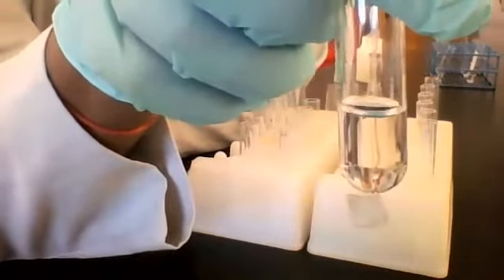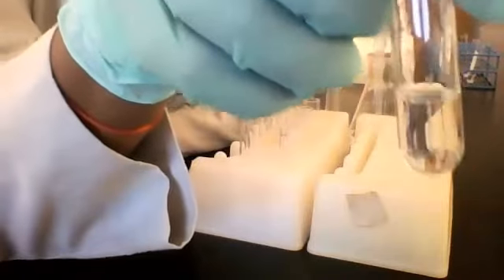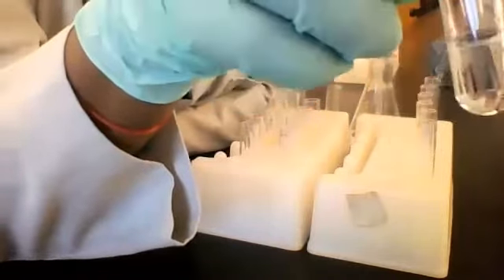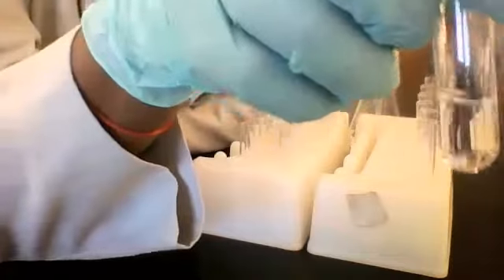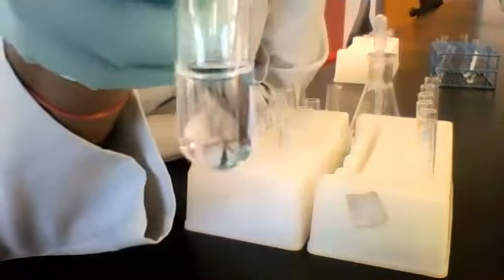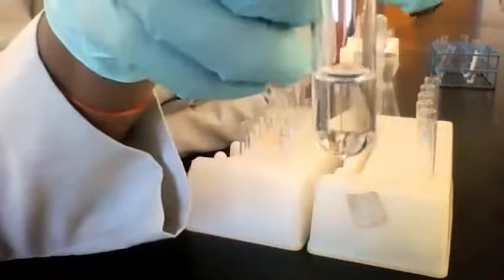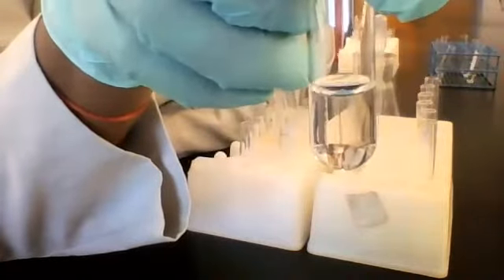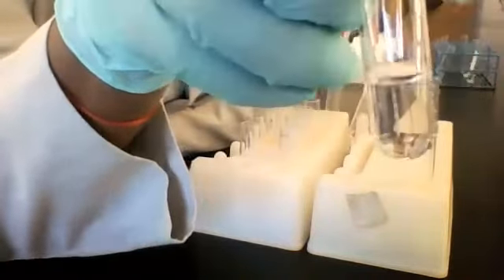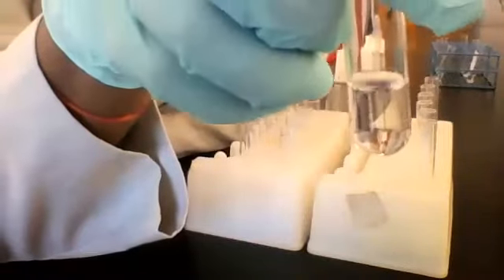So even if, let's say, there's one sodium ion that used to be with a carbonate ion, and it leaves the carbonate ion and goes and grabs a hydroxide. And then the sodium ion that used to be with that hydroxide leaves the hydroxide and goes and takes the carbonate ion. Well, we still end up with sodium paired with carbonate and sodium paired with hydroxide. Nothing has changed. No new compounds have formed. So we're not expecting to see anything.